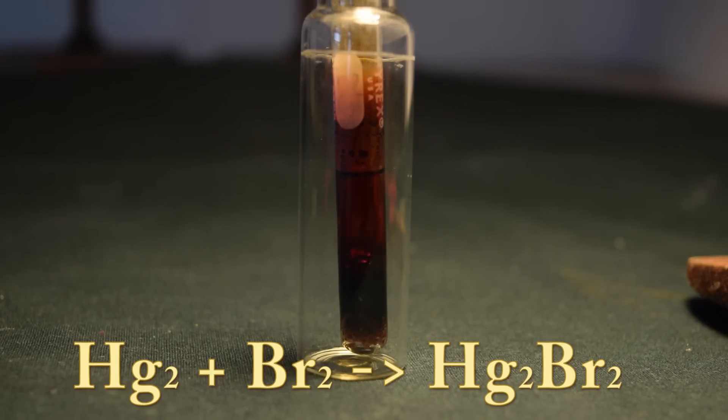It took a couple minutes, but an exothermic reaction started, and it is hot enough to start boiling the bromine.